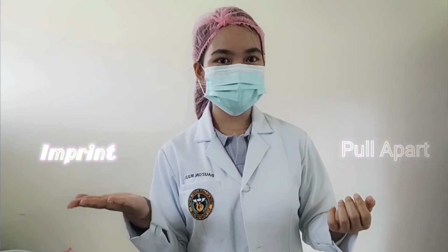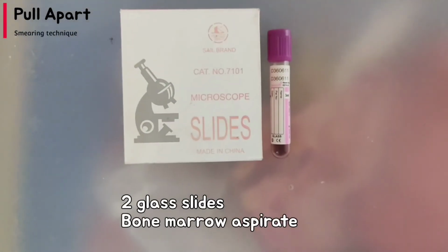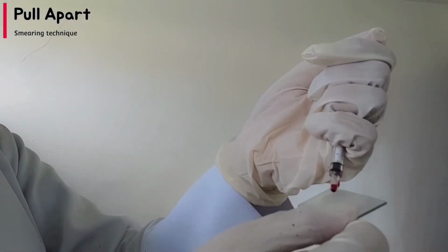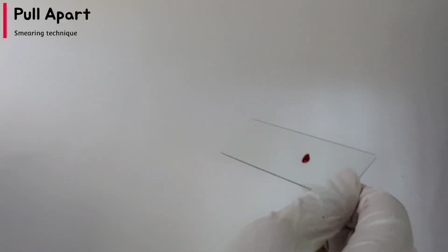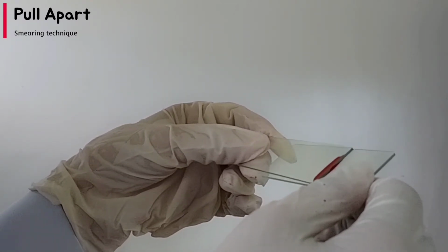Hello, this is Marian Bea Di Bauzon, and I'm going to perform smearing techniques such as pull-apart and imprint. For the pull-apart method, I will be needing 2 glass slides and a sample, which is the bone marrow aspirate. Place a drop of the sediment at one end of a glass slide. Cover it with the end of another glass slide.